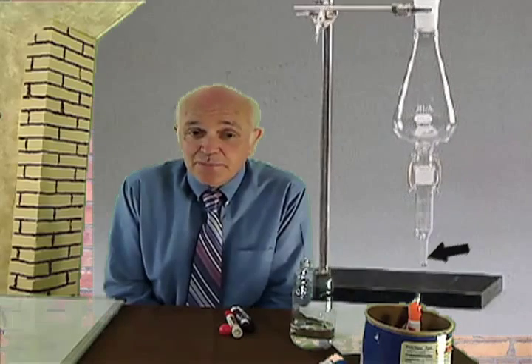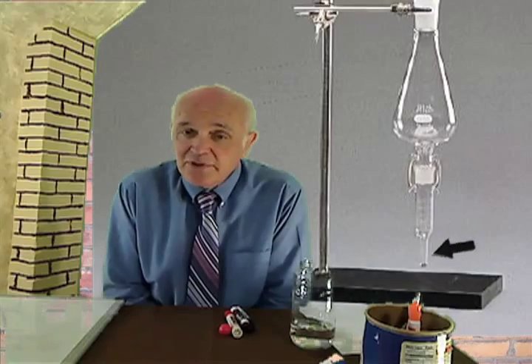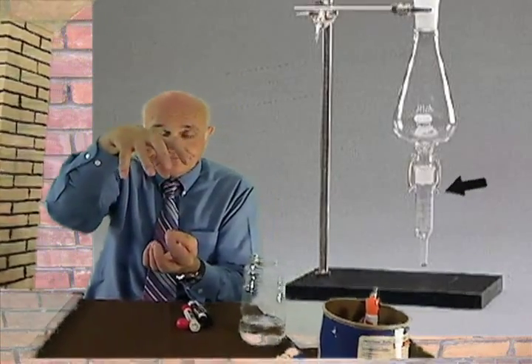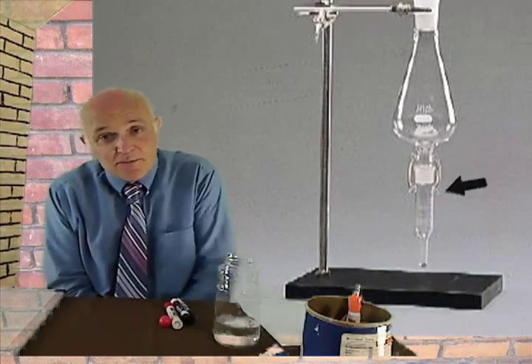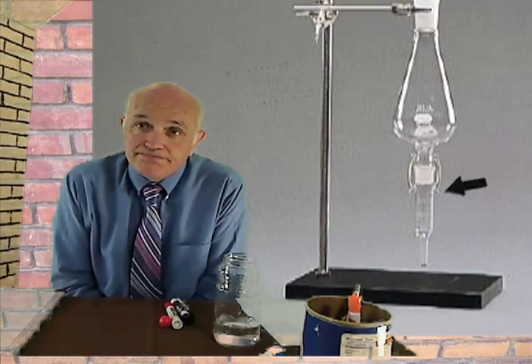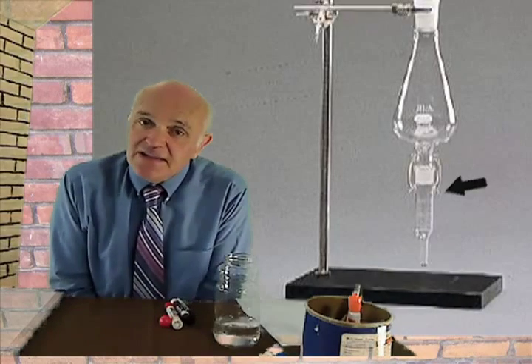And then at the bottom of this conical flask is a little graduated cylinder. And when I say little, I mean it's pretty small, like maybe 10 mils altogether, maybe 20 mils altogether, but it's graduated. The bottom column is put into the top column. The methylene chloride is poured into the whole thing. And then the Snyder column is put on. Sometimes they're held together with springs. Sometimes not. And then this whole thing is put in a steam bath.